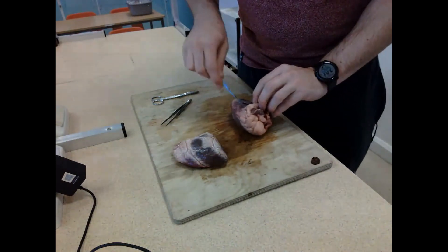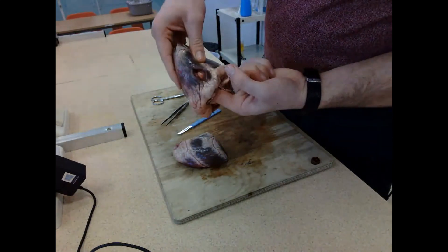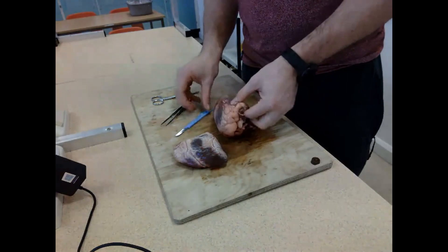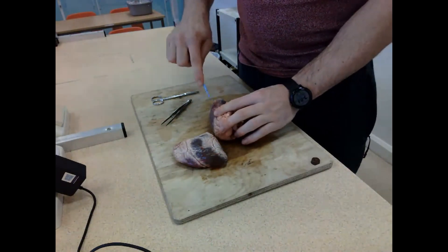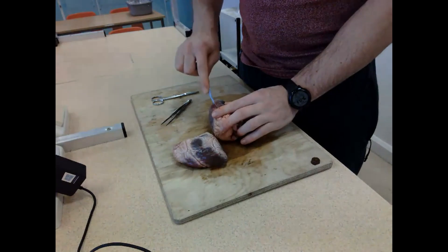You can see my finger pops out through the hole, showing I've cut into the right atrium. I'm then feeling to find where the ventricle is - it comes across to the side, so my angle of cut is slightly different. I'm using my scalpel - please note I'm cutting away from my body, not towards it. That is an important safety feature you should state in your exams.